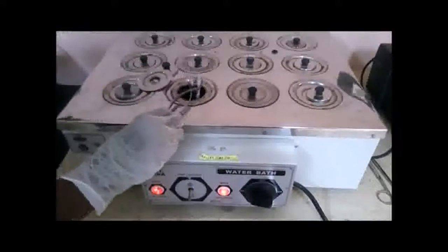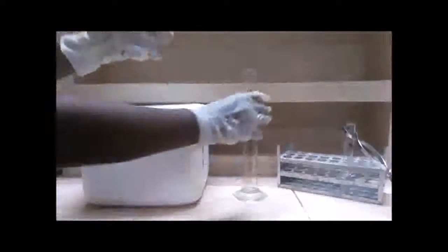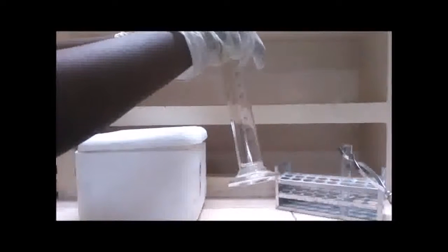Again shake the mixture vigorously. Now transfer the reactant mixture into a boiling tube. Now place the reactant mixture for boiling at 50 to 60 degrees Celsius. Add 15 to 20 ml of ice cold water to the reactant mixture.